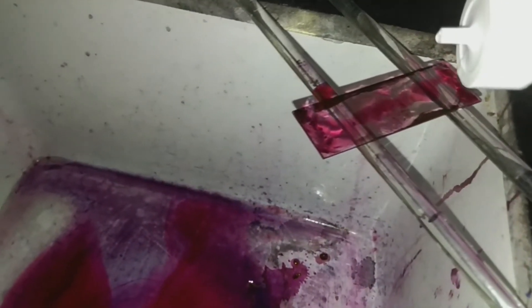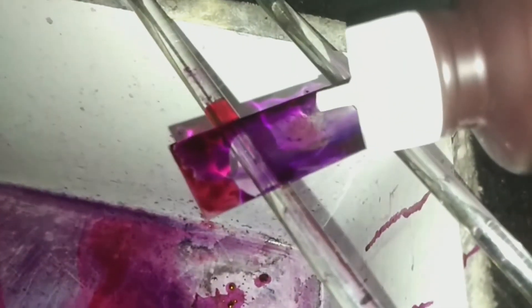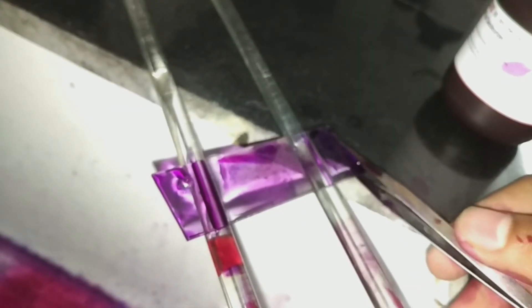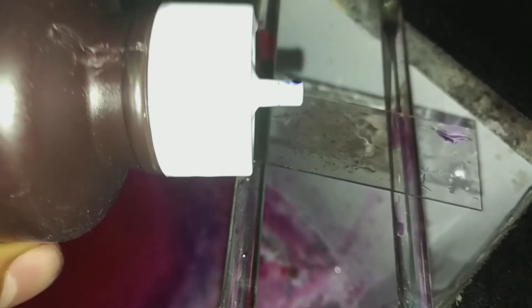After applying the acid fast decolorizer, you will see the dark pinkish color becomes faded. Continue decolorizing with the acid fast decolorizer until the color has sufficiently faded. After decolorizing, the slide will appear lighter in color.